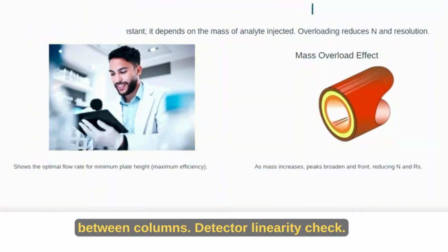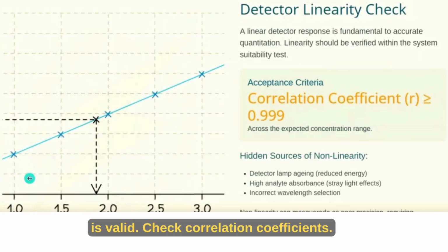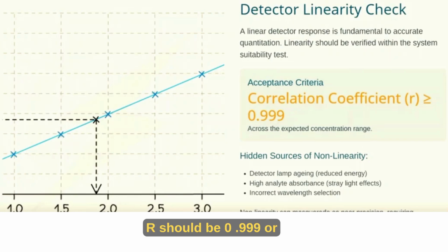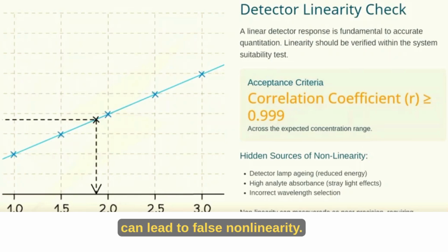Reduce injection volume. Over-injecting can physically split your sample at the column head. Drop your injection to around 5 microliters for a standard 4.6 millimeter column. You'll get a cleaner, single peak without losing signal strength.